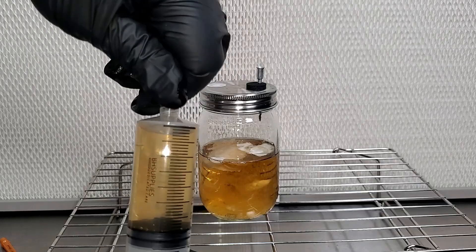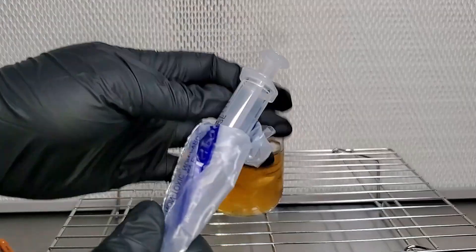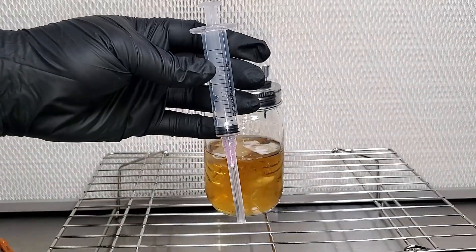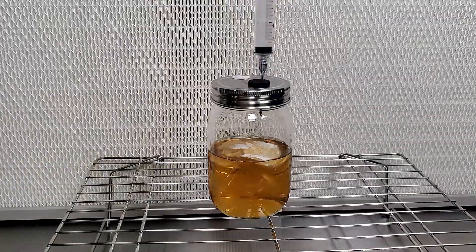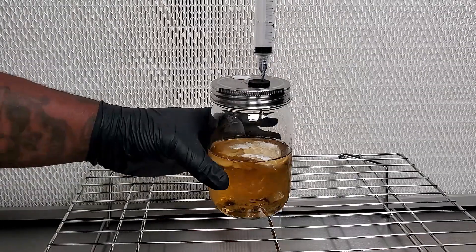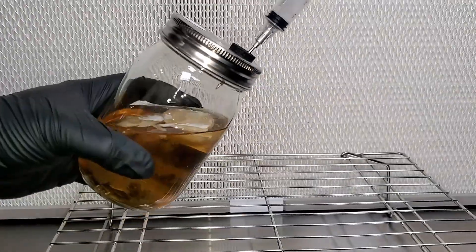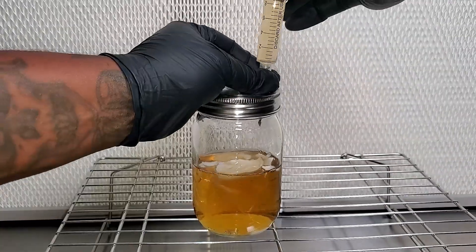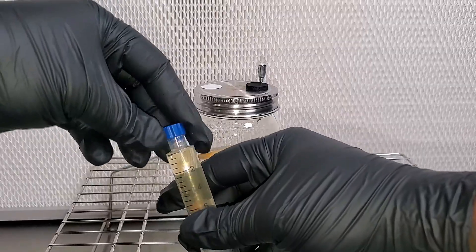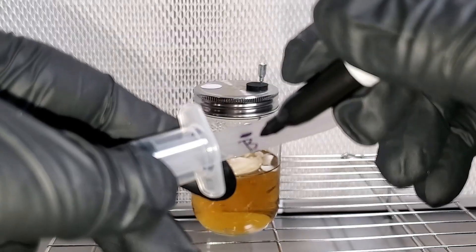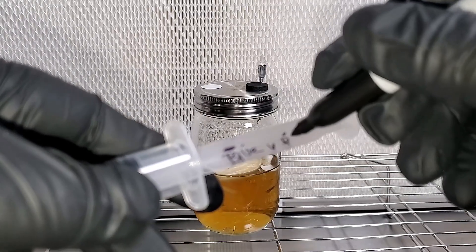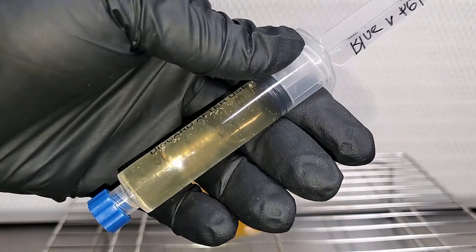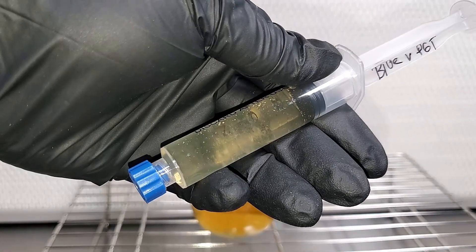So now what I'm going to do is I'm going to do the exact same thing, but instead of using this big 60 milliliter syringe, I'm going to use a 10cc syringe. So check this out, this is probably the size syringe that most of you guys are used to, I know I am. And so like I said before, you're going to actually do the exact same thing. You have to tilt over the jar so that it will reach. To do these, it's way easier. Pull out the liquid culture, spray the stopper for your syringe, put it on the end, and there you go. Once you have that done, you want to label it. I always label it with the strain and the company that I got it from, or the person that I got it from. I also will put the date on here. I forgot to put the date in the video, but I will put the date so I know exactly what day I actually did this. Now check it out, you can see the mycelium inside the syringe. We have some great liquid culture.